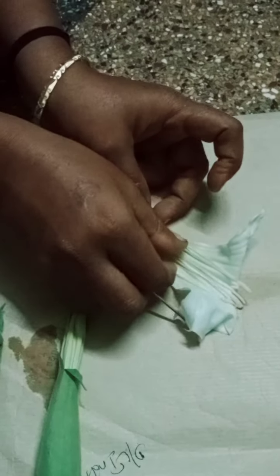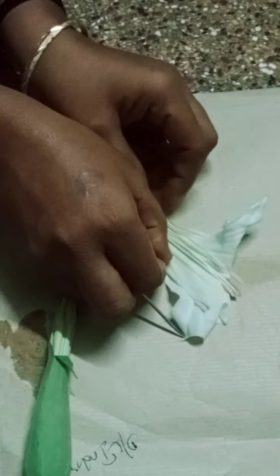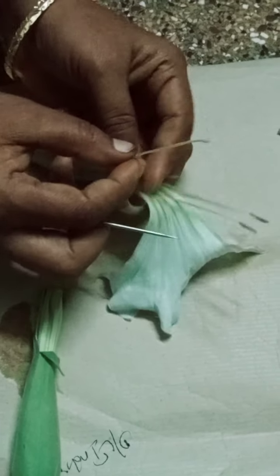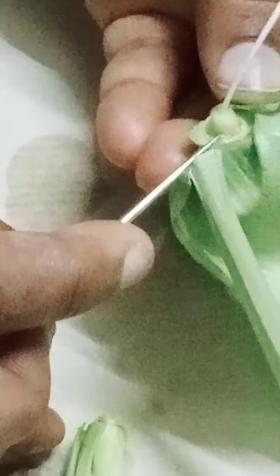This is the female reproductive structure of the flower. This part here is the stigma — this is the stigma of the flower. There are three parts in the female reproductive structure: one is the stigma, then the style, and below at the base you are seeing the bulb-like base which is known as the ovary part of the flower.